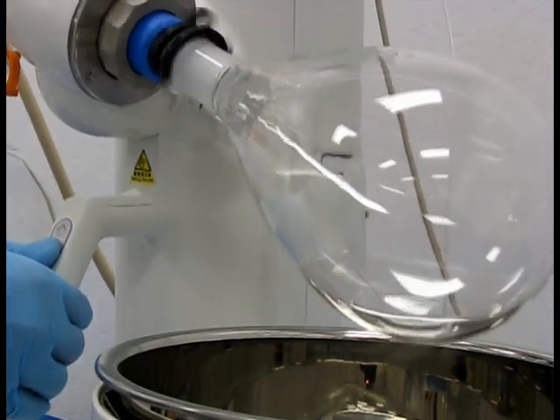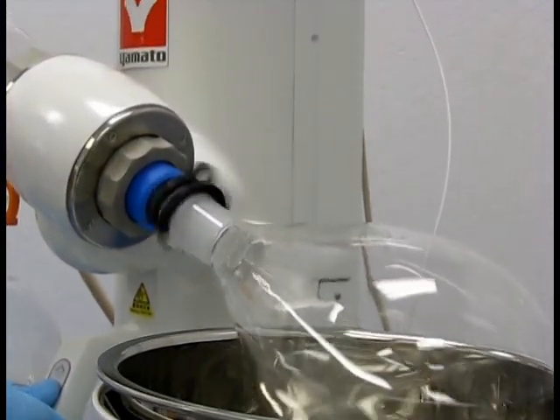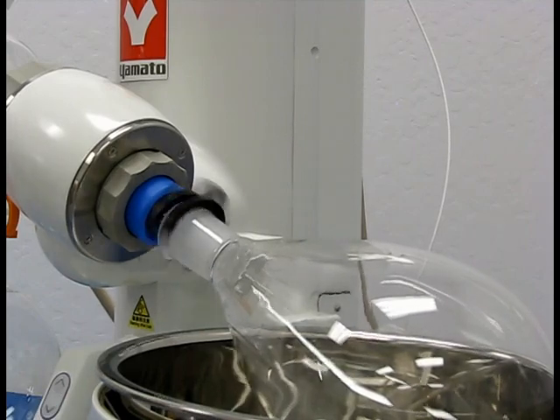Once the target temperature on the bath has been reached, lower the evaporating flask into the bath using the controls on the lift handle.